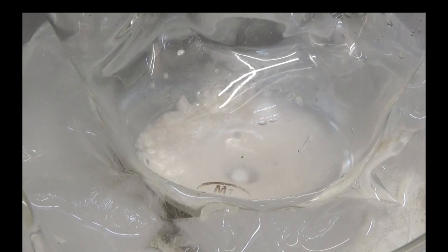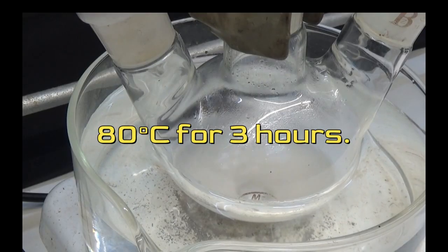Once the thionyl chloride has been added, heat in a water bath at 80 degrees Celsius for three hours.